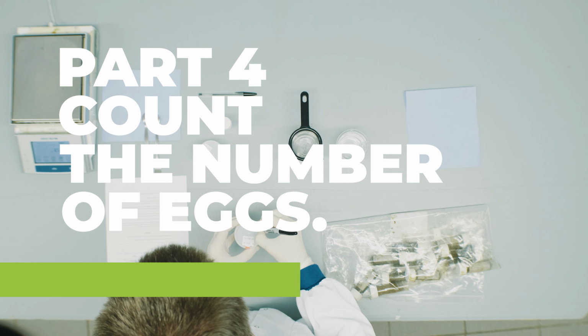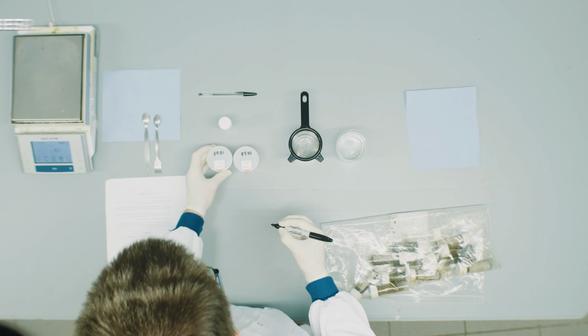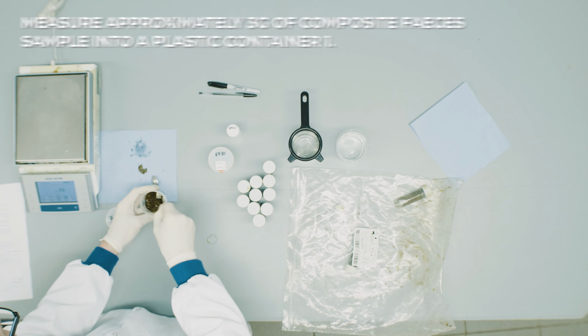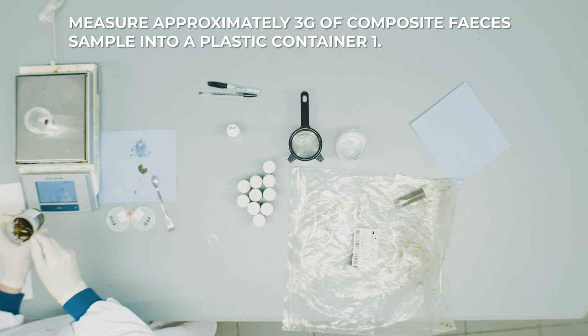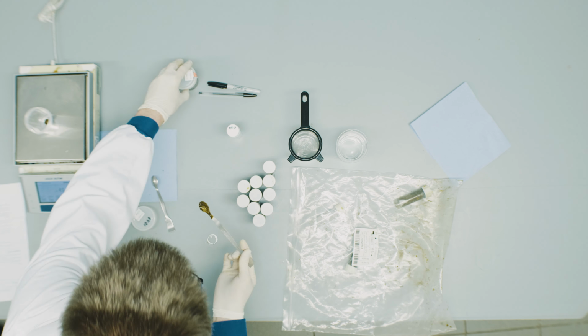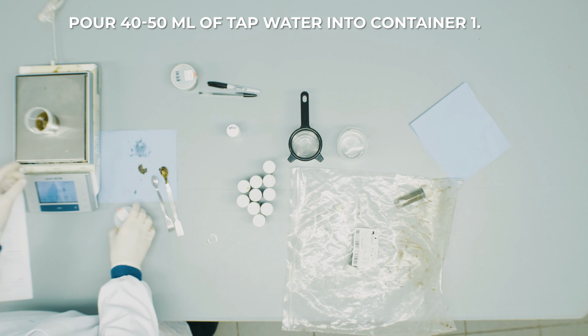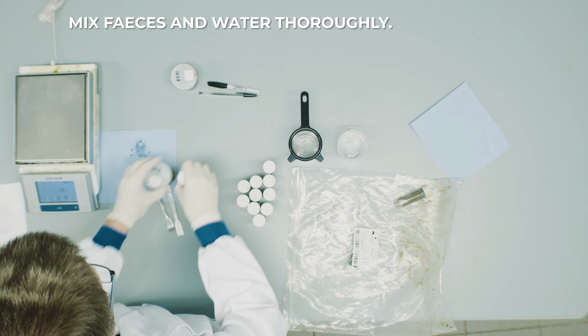4. Procedure to count the number of eggs in the composite sample. Label all containers with the sample work number. Weigh or measure approximately 3 grams of composite feces sample into a plastic container 1. Pour 40 to 50 ml of tap water into container 1. Mix the feces and the water thoroughly.